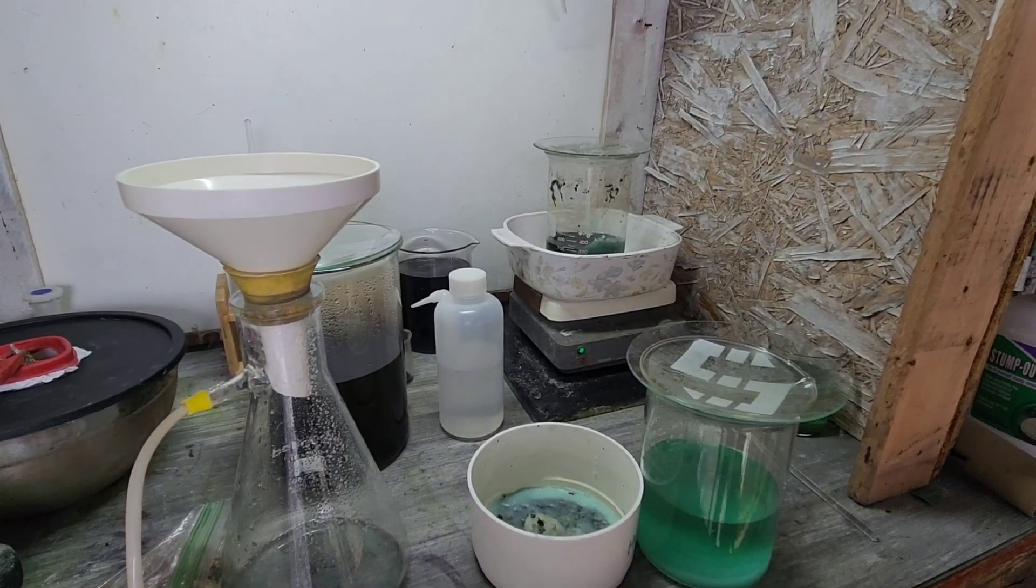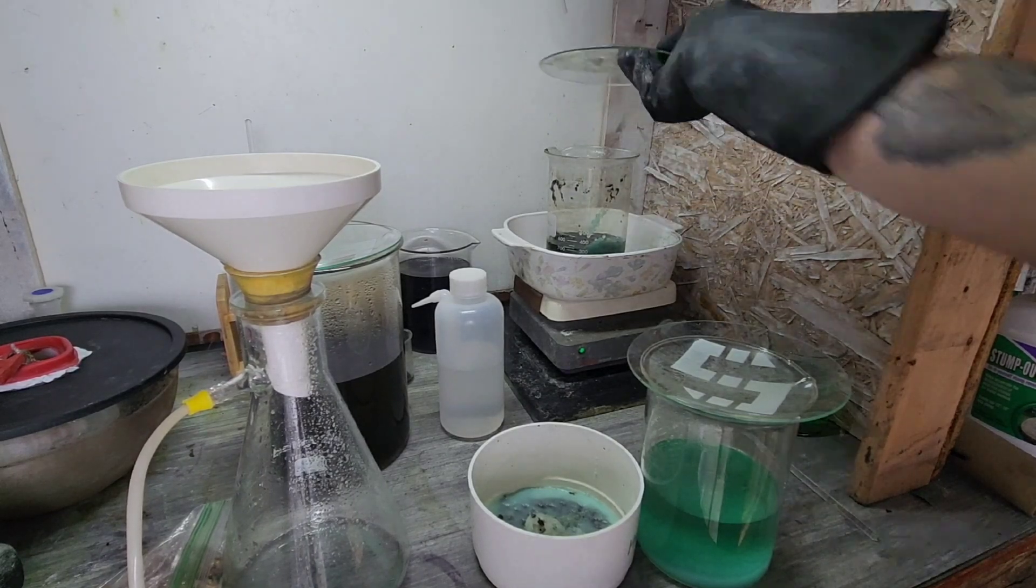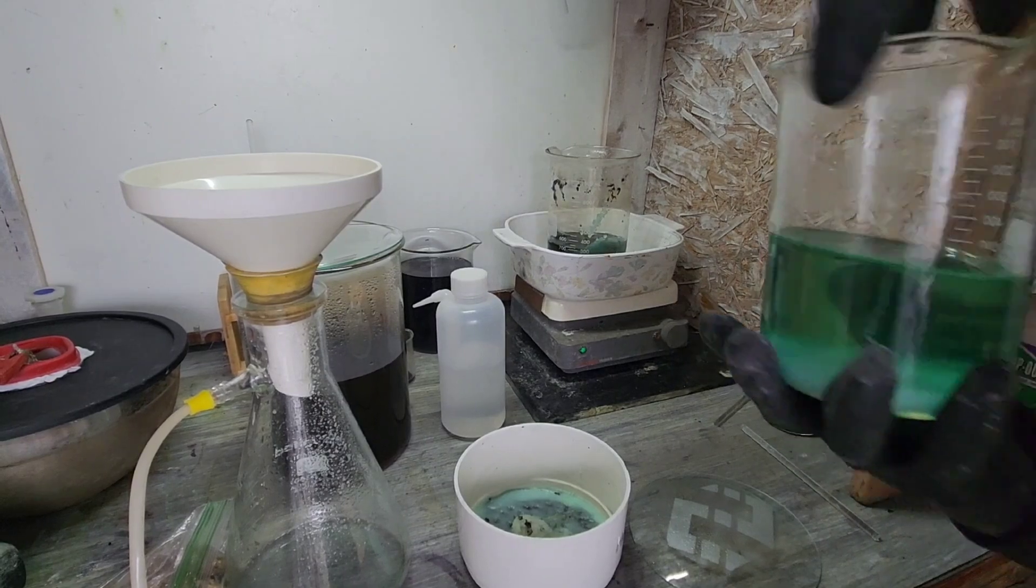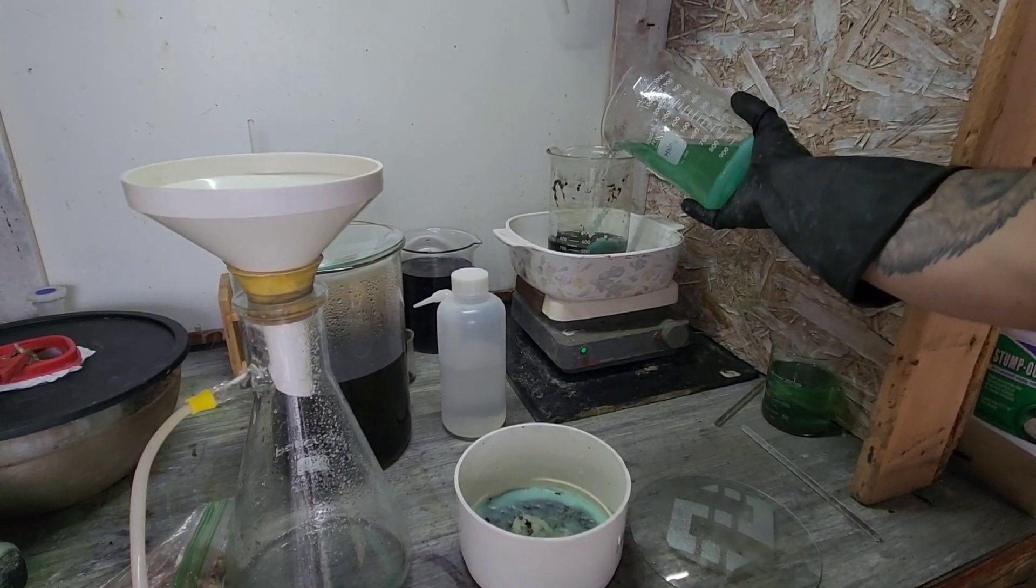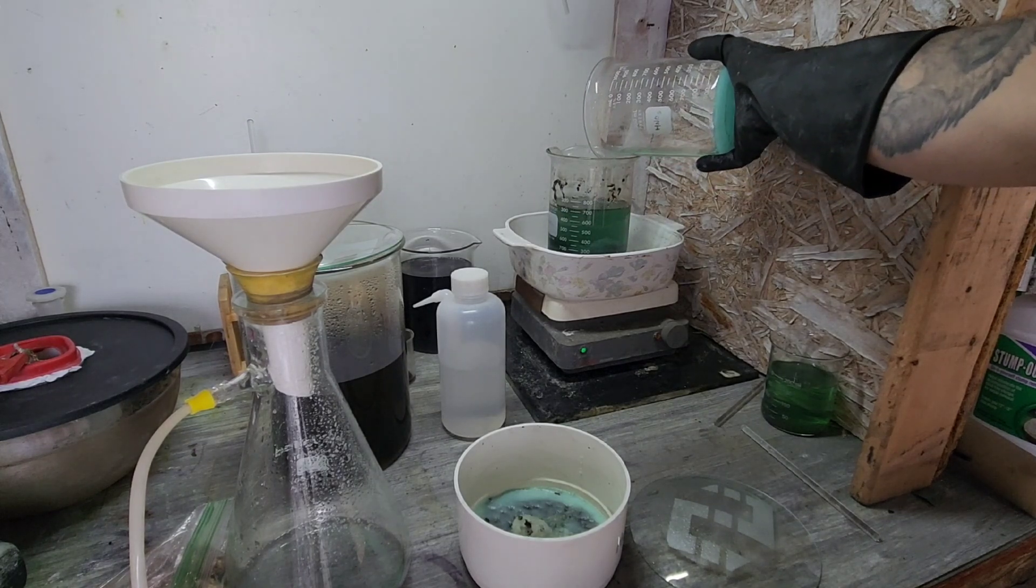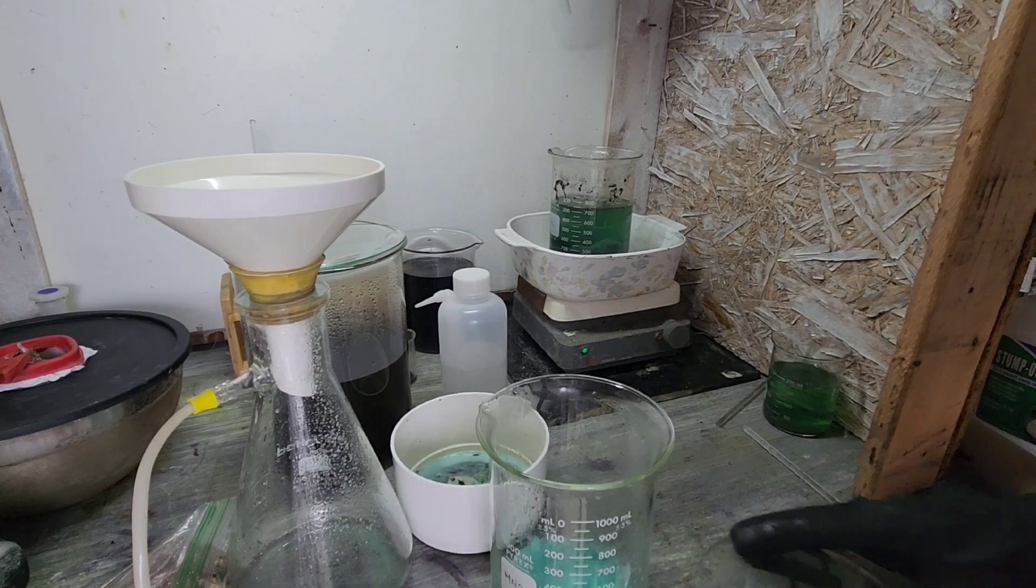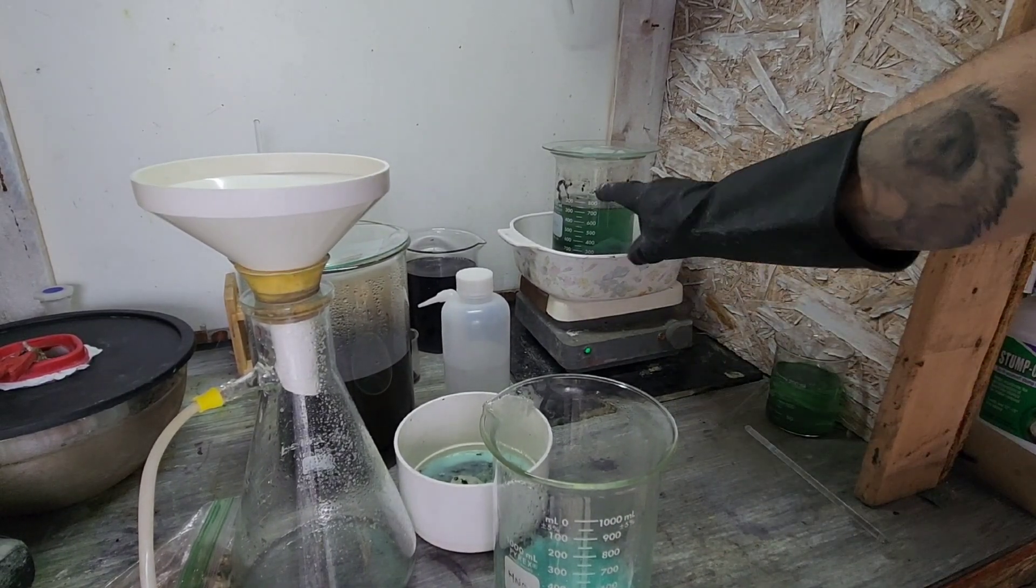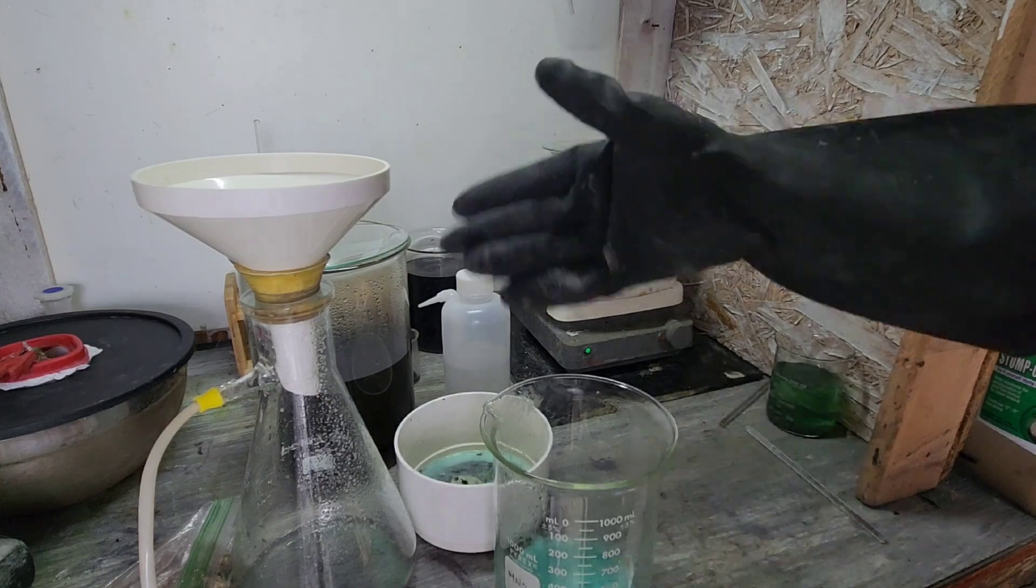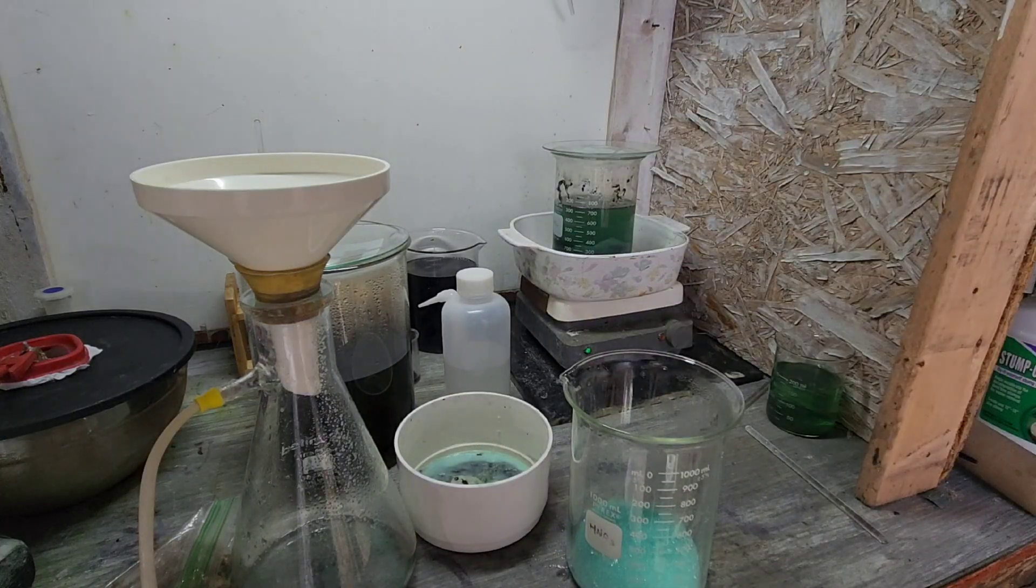All right, so I just brought my crystals back in from outside. We're going to go ahead and pour the liquid back into our original beaker here. This is room temperature, so it's been off heat for some time, just so I don't thermally shock anything and break anything that I don't want. All right, and as that warms up, our solutions start to absorb some more ferrous sulfate crystals, and basically we just rinse and repeat until we've got as much ferrous sulfate as we need.